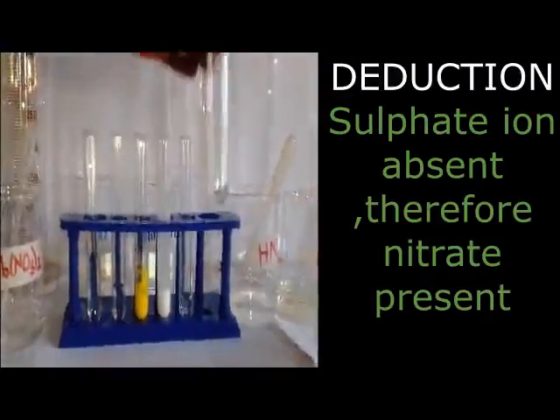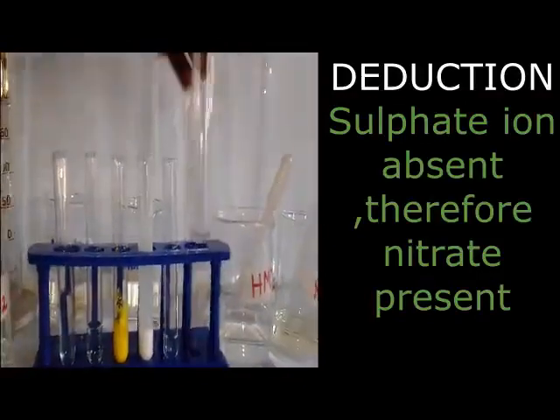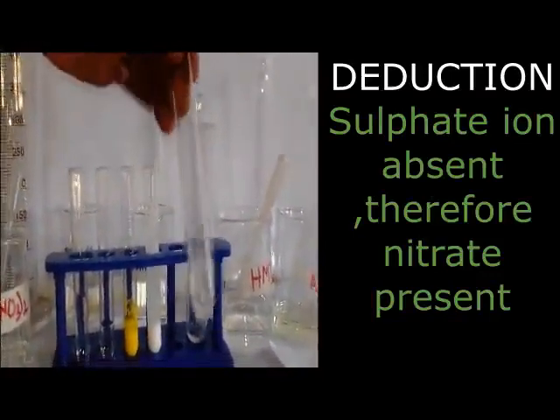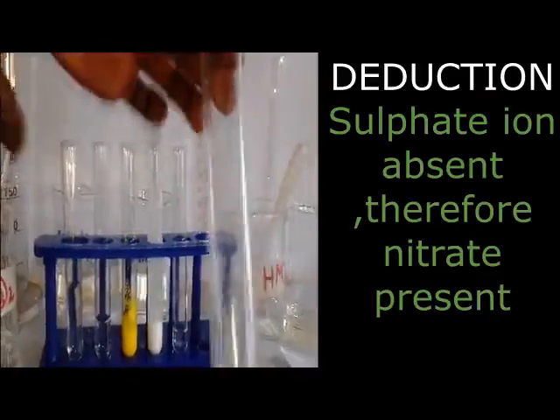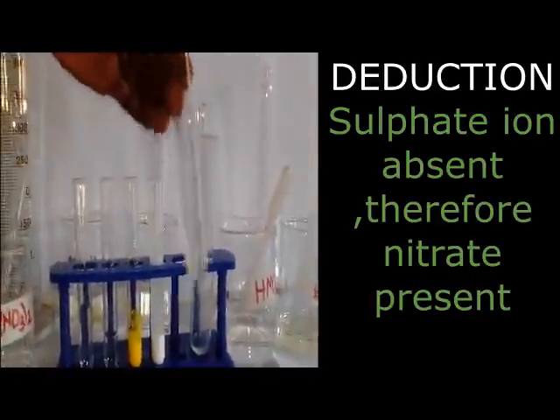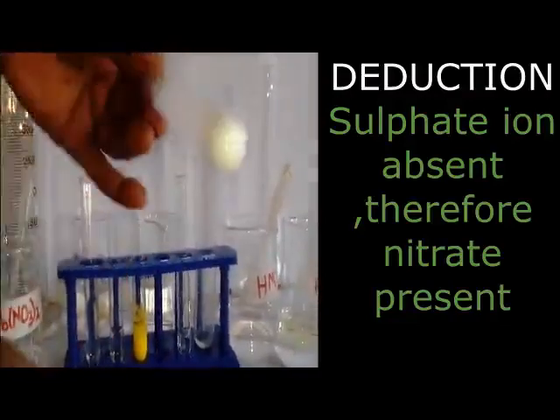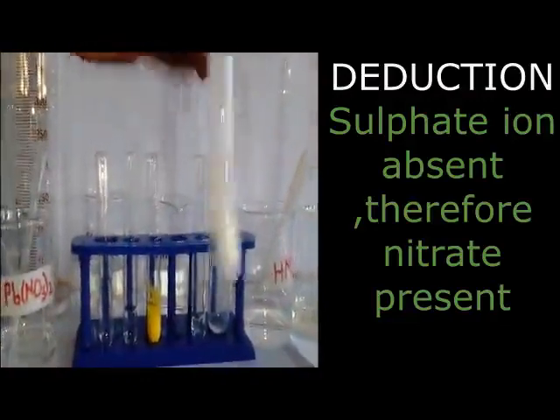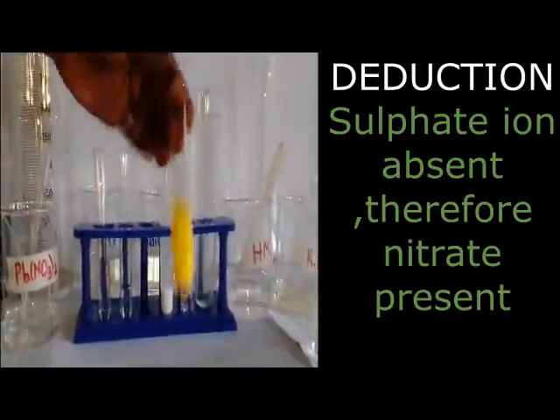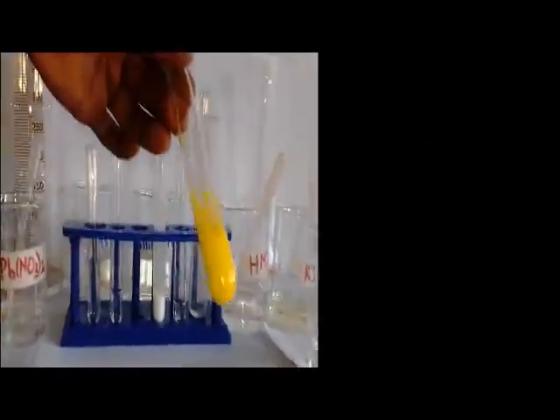We are going to apply what we call the elimination method to reduce to the nitrate. Since the salt gave us brown fumes as we were heating, where there is an anion present, we are going to put nitrate. Where are we putting nitrate? We have checked for the sulfate and the chloride, they are not there. Yet at the heating, we got brown fumes, which can only be given out by what? By nitrate. So we say nitrate present.